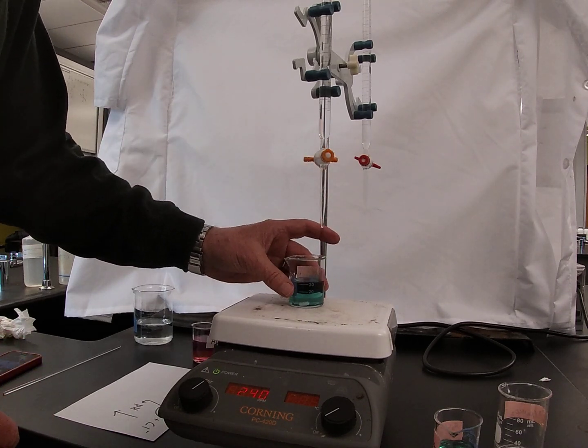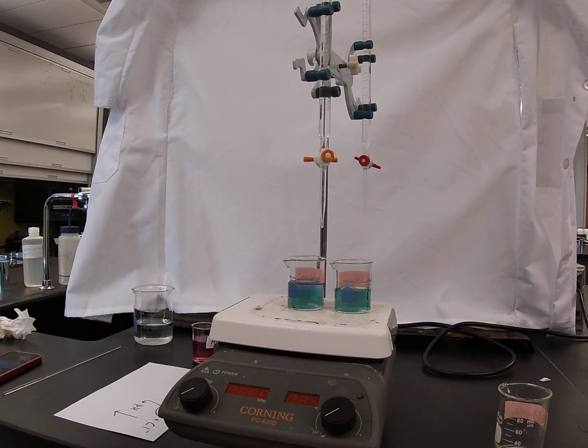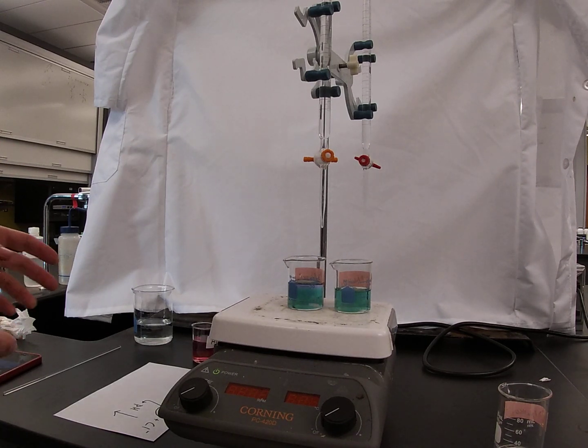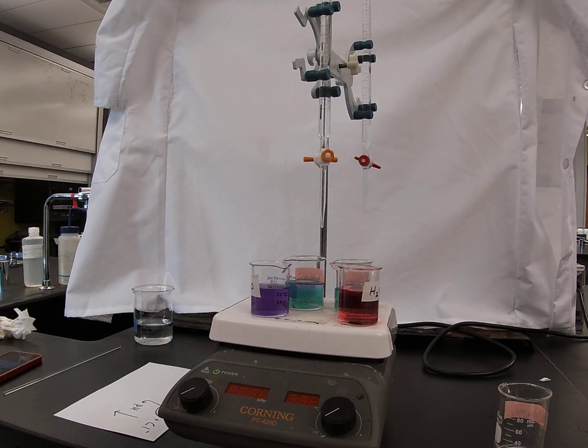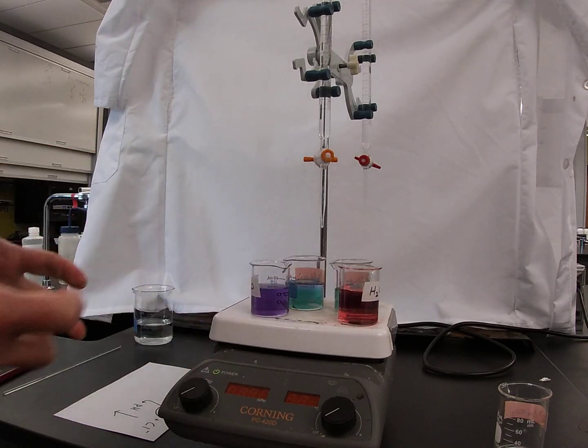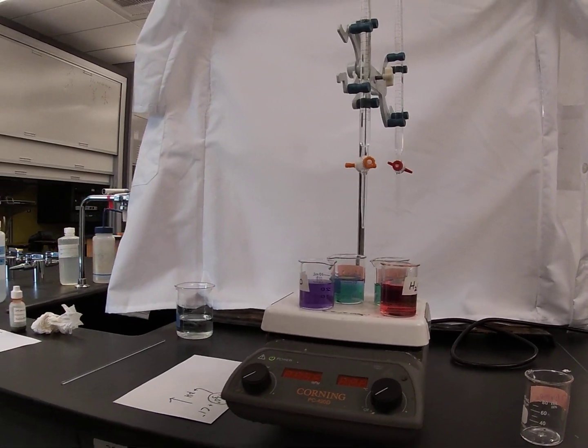Here is the beaker containing the buffer and the sodium hydroxide, and here the beaker containing the buffer and the hydrochloric acid. Note that they are essentially the same color, indicative of the fact that the addition of acid or base didn't really change the pH, compared to our deionized water control beakers, where the addition of acid produced an immediate decrease in the pH, and the addition of sodium hydroxide produced an immediate increase in the pH, both of which would be presumably lethal to some organism. But buffers have the ability to absorb and regulate that pH, and as a result perform an amazing role in the maintenance of homeostasis in larger organisms. Pretty cool, huh?